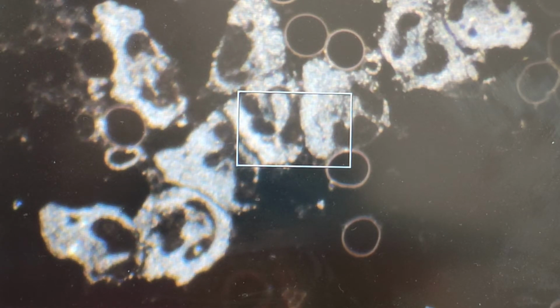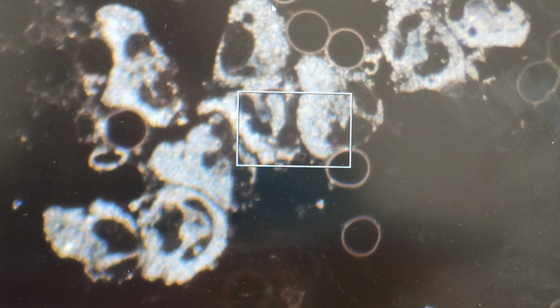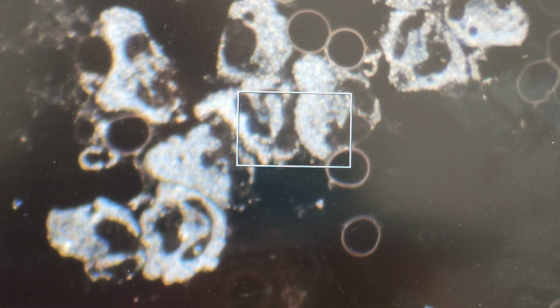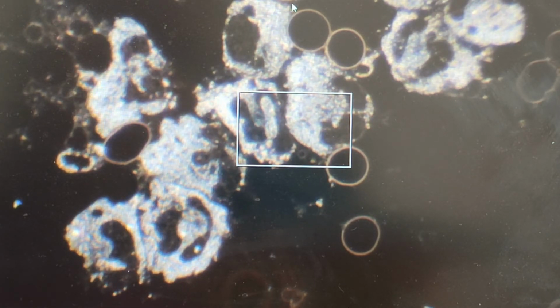And the white blood cell is extending itself towards it. It's almost chasing it. So I wonder if there are some rather interesting chemicals in this blood sample in this area, and maybe all of these white blood cells have engulfed it. And once it gets inside the cell membrane, it's been engulfed and it's almost there. These white granules will start to dissolve it and break it down. Once it does that, it may well put out a signal in its membranes, or put out a chemical to call other white blood cells to the area for help.